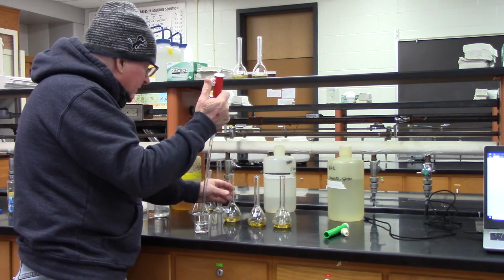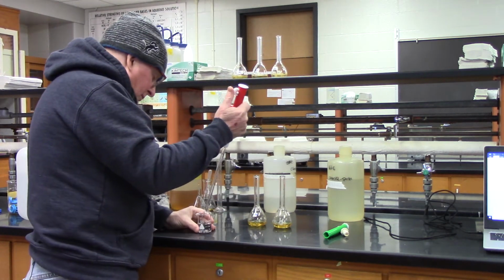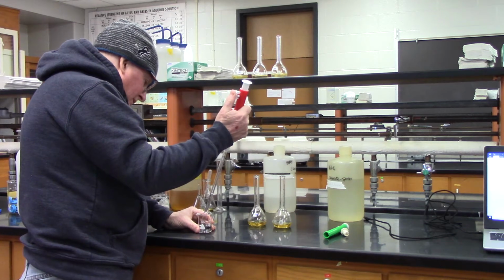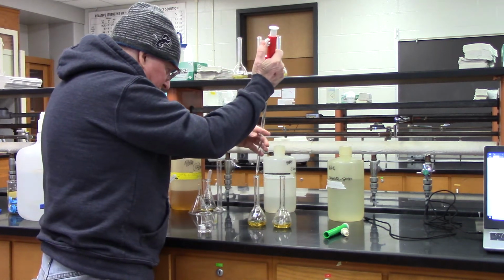Okay, so that's 4. Now I'm going to go up to 6 mils, which is 4 on this. That's 10 minus 4 is 6.